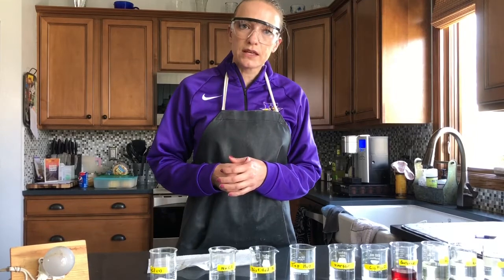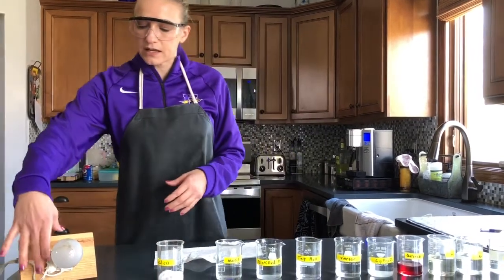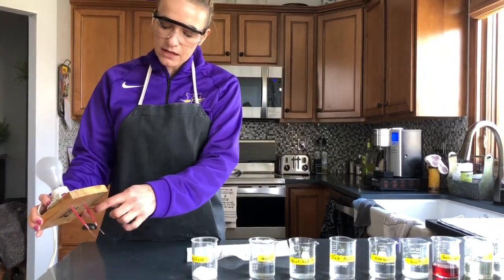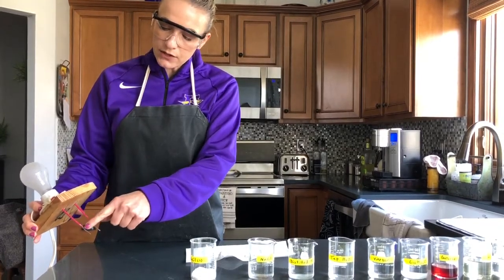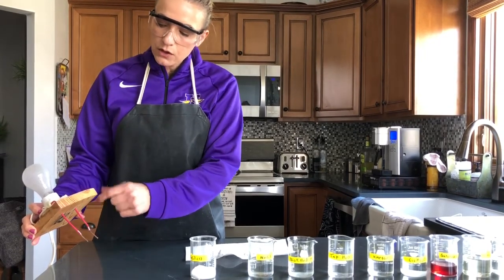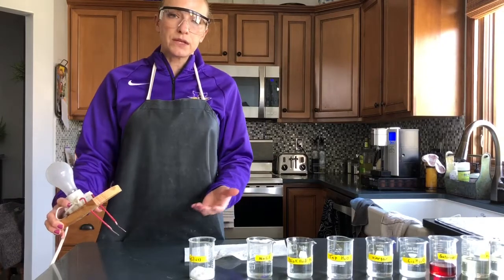What we're going to do is test for the conductivity of several different solutions. We do that by using the conductivity meter. Basically, this is just a light bulb. I have it plugged in, and the light bulb has the electrodes going down. One of the electrodes goes down and transfers electricity. If the substance conducts, that electricity will transfer to the other electrode, go up and light the light bulb. If it does not conduct, that electricity won't transfer between the two electrodes, and there will be no light.